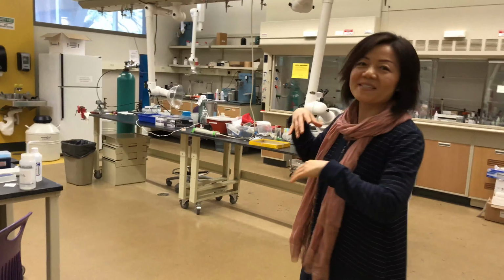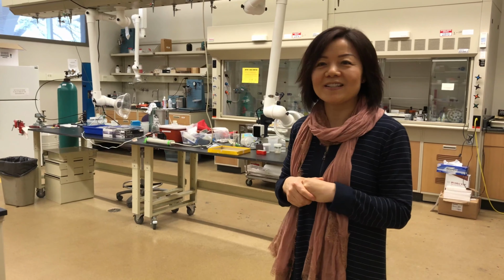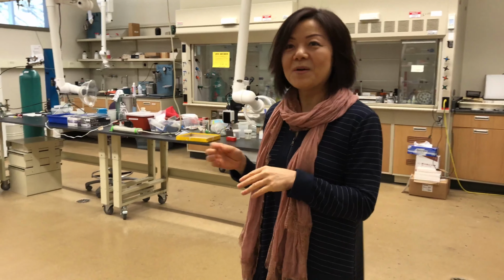The big lab is basically for sample preparation, and we have a TEM expert who is busy here most of the time, preparing samples. Whether you want to check it under SEM or TEM, you have to prepare your sample and get it ready for SEM or TEM.